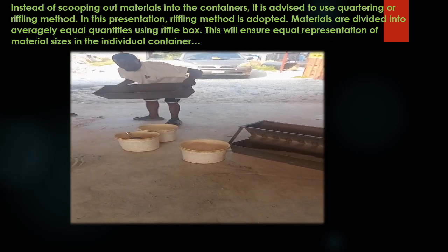Instead of scooping out materials into the containers, it is advised to use the quartering or riffling method. In this presentation, the riffling method is adopted. Materials are divided into averagely equal quantities using a riffle box. This will ensure equal representation of material sizes in the individual containers.